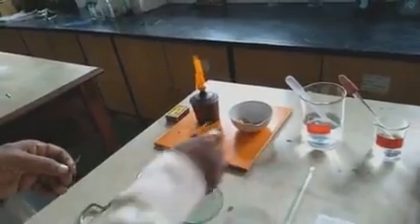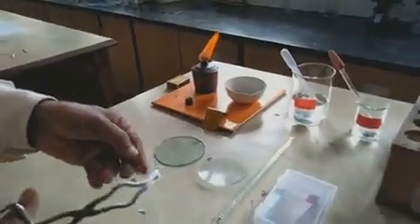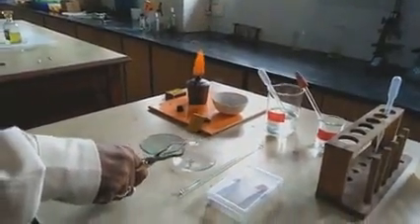Now let us study the first reaction with magnesium. Take a piece of magnesium ribbon and polish it with the help of sandpaper. After that, hold this with the help of a pair of tongs and burn it over the spirit lamp. You will find that the magnesium ribbon burns brightly and you get a white powder. The magnesium ribbon is burnt and we get white powder.